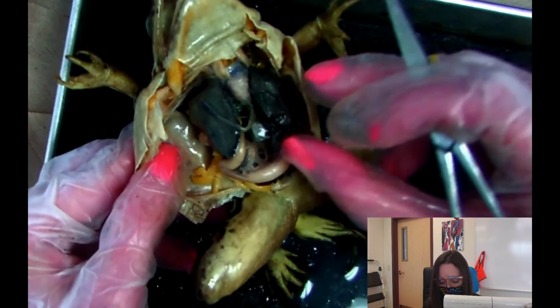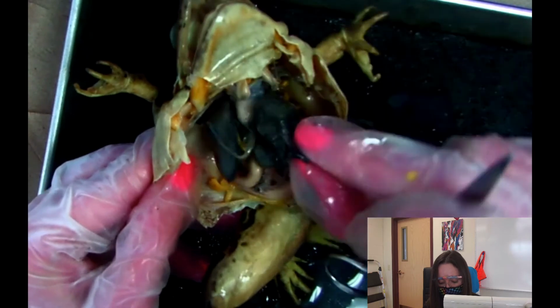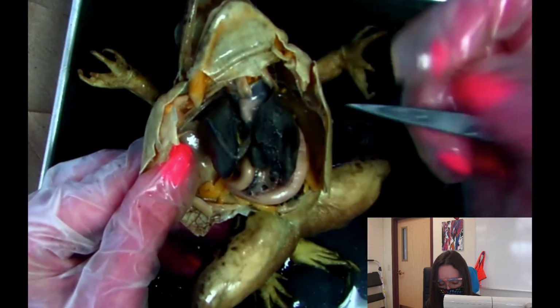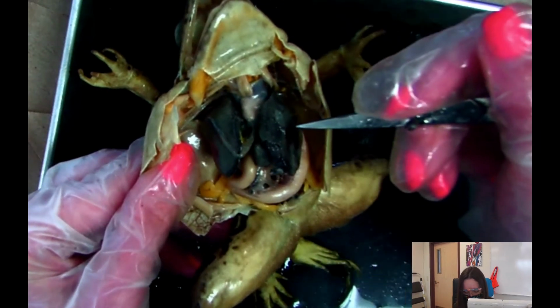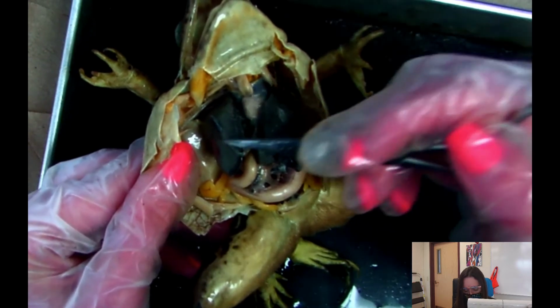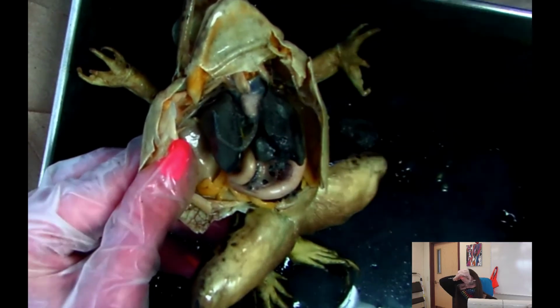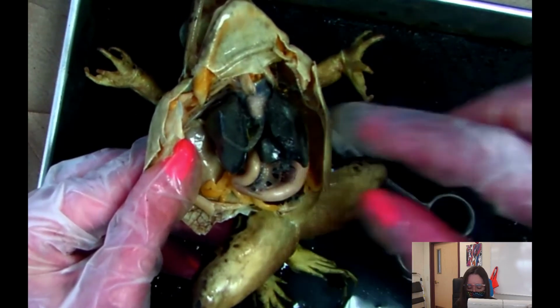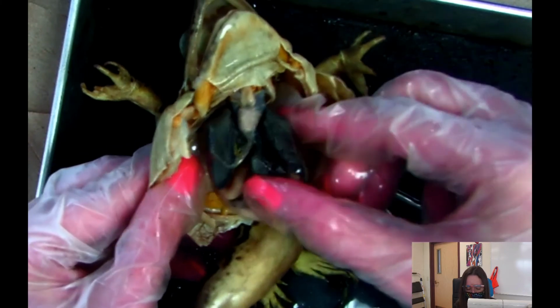And so the liver, and I'll show you what the lungs look like so that you don't confuse them because they look quite different. But the liver is basically one of the biggest organs in the body, okay? So this is the liver. So you'll see it right away. It's pretty big, and you'll have a really good visual on Quizlet. So I'm actually going to take out the liver so we can see other parts pretty easily.